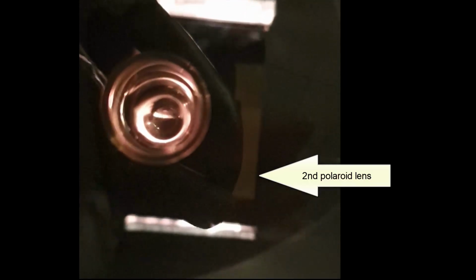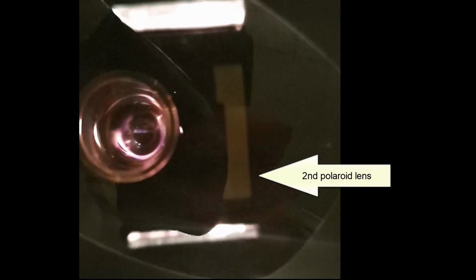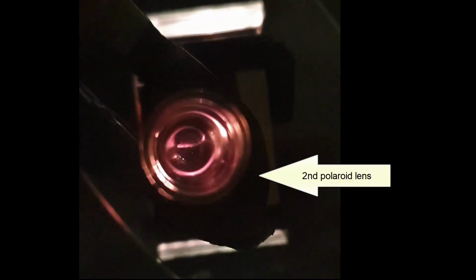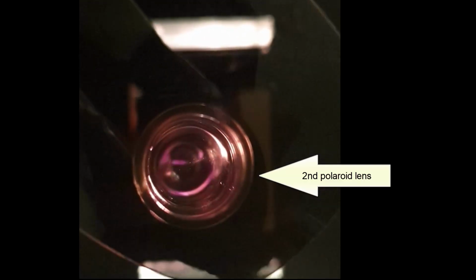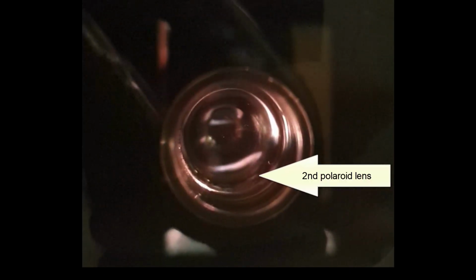I am getting all of the yellow light to disappear, and that's at close to, it seems to be a 45 degree turn. I'm getting a 45 degree rotation, and that's with a dilute solution. So that could be accurate. It could be about half of the saturated solution.